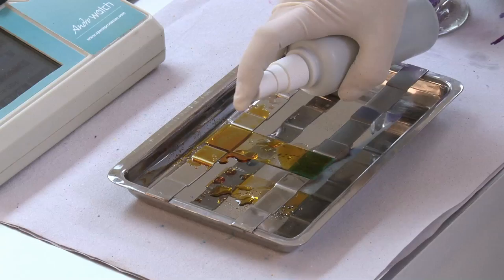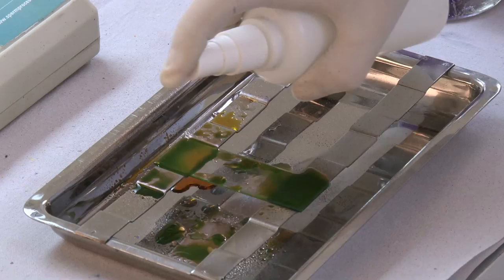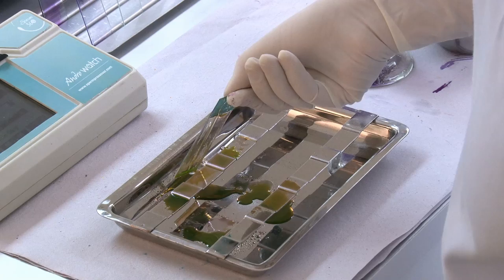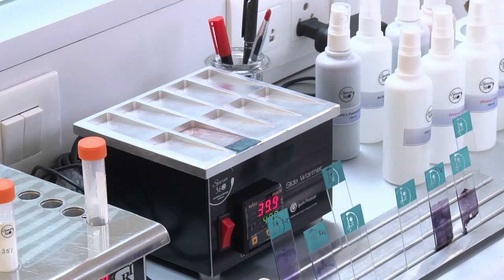Cover the smear with EA50 and keep it for 1 minute. Cover the smear with 95% ethanol and keep it for 90 seconds. Drain off the solution. Keep the slide on the slide warmer to dry.